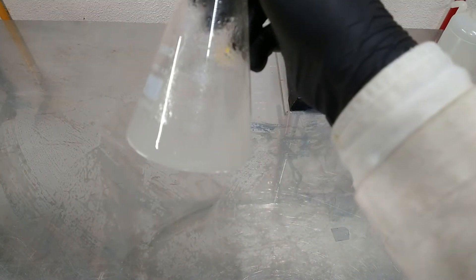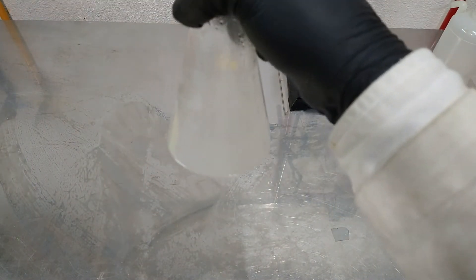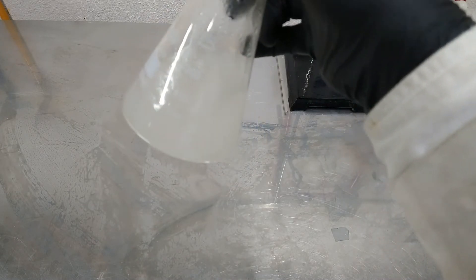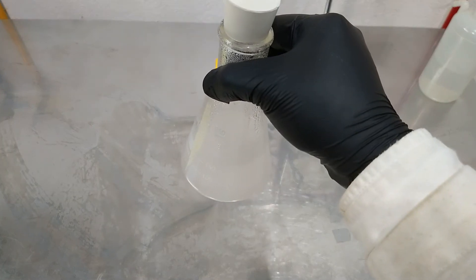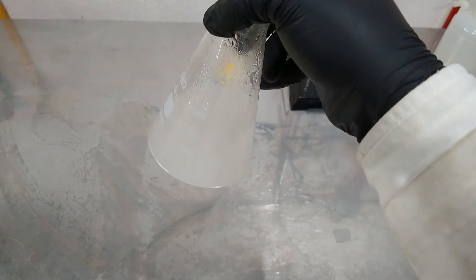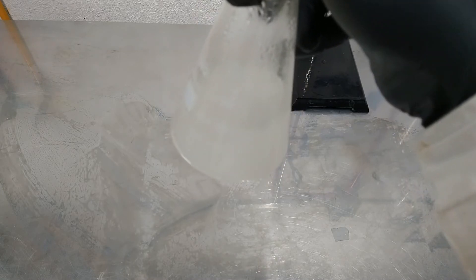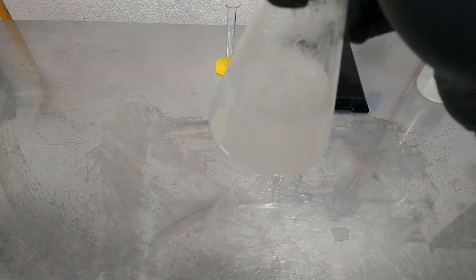So here is our product after the 8 hours of refluxing and we have already removed the boiling chips so we can let it in the freezer overnight so the product can crystallize, tomorrow we will filtrate and wash the product.